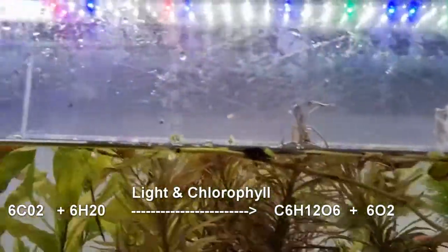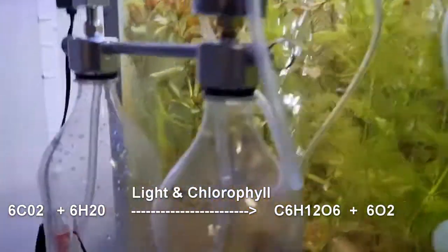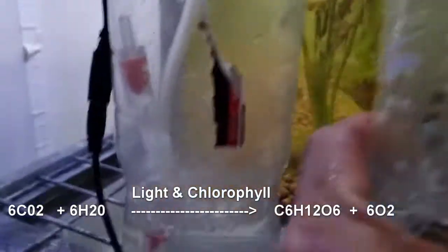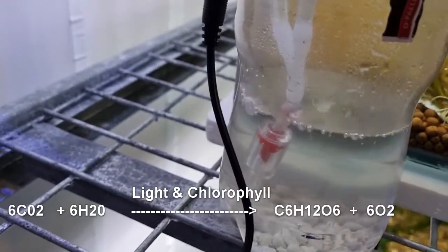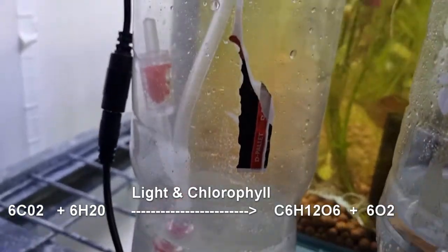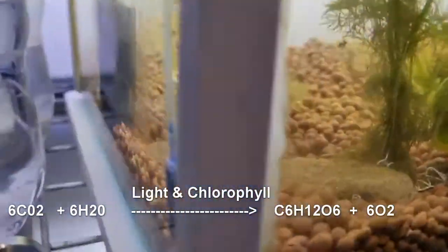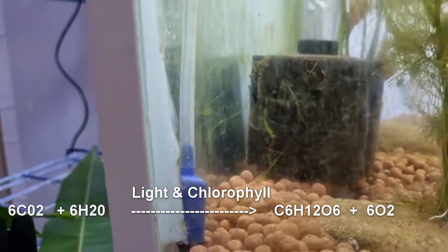Now over here I've got a little system which has hydrochloric acid in there, and it has calcium carbonate over here. We can then pump some of the hydrochloric acid over into the calcium carbonate, and that will start generating CO2 through a chemical reaction, acid on carbonate, and then we can bubble that through. You'll see this little air stone there, that's now bubbling CO2 into our water.